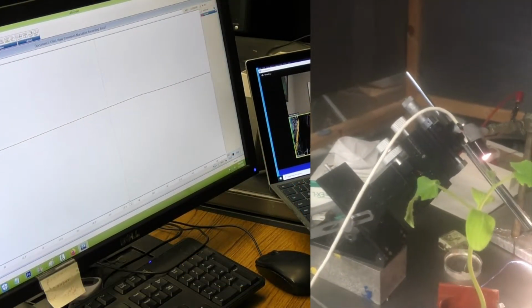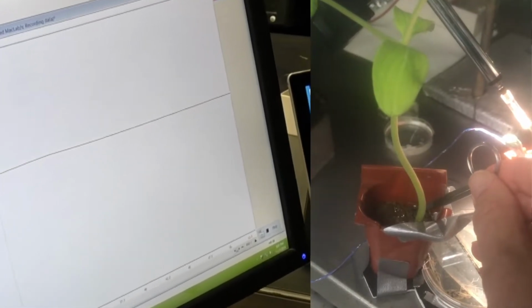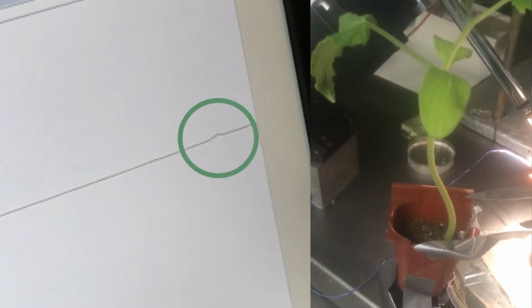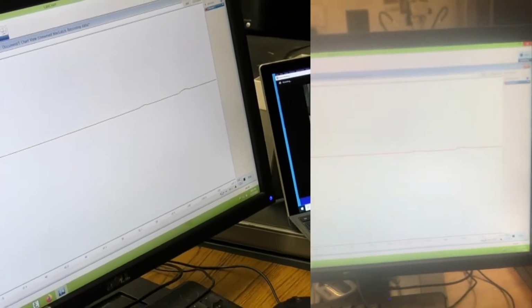I guess soil touch, right? Yep. And with the metal electrode, it might give us something. Okay, 1, 2, 3. Soil touch. Oh, I did see a little glitch in the recording up there. I'll do it again a little deeper. Soil touch. Yep, it makes a little movement. I'll get it on this camera too.